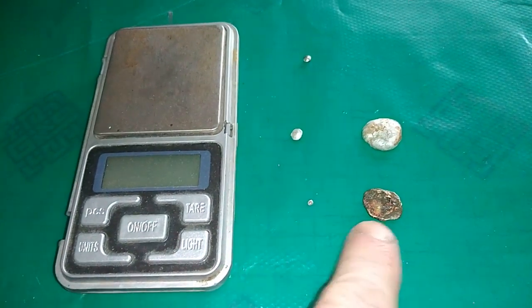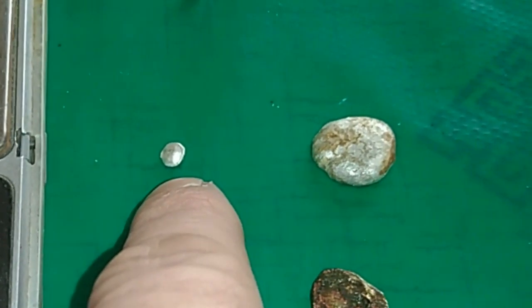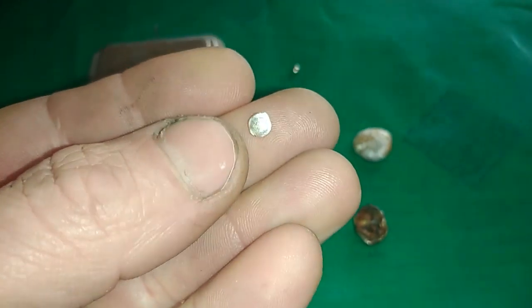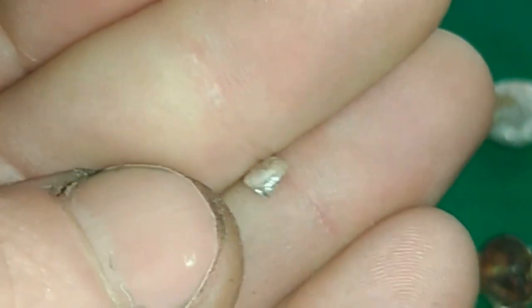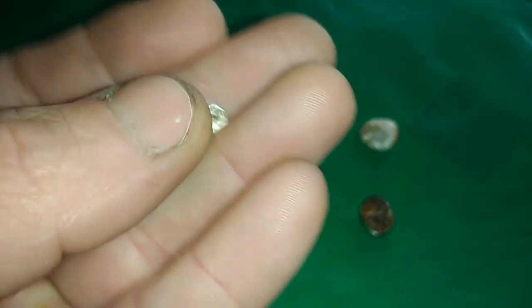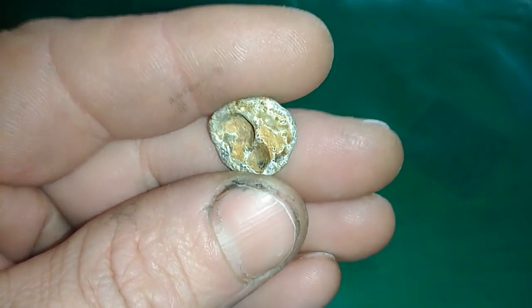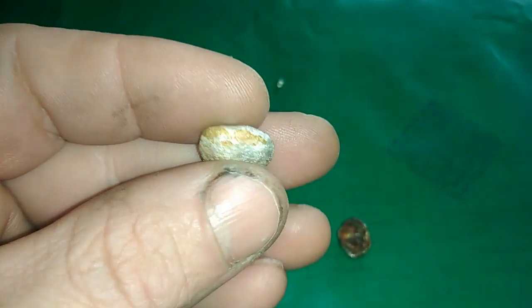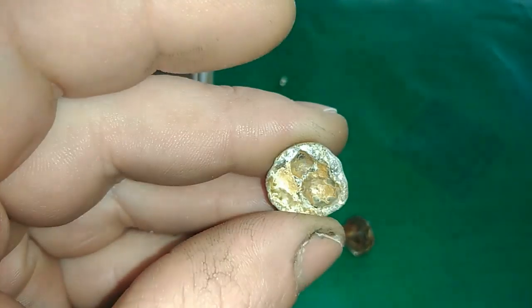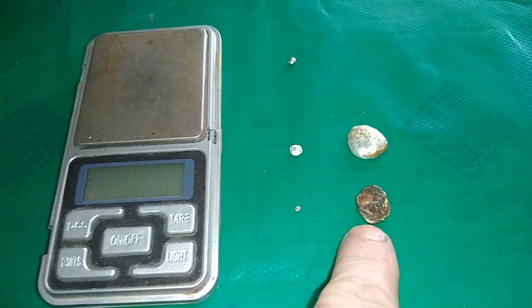This is from magnetic pins. This second line — this bead and this bigger bead — it's from non-magnetic MLCCs. This is our palladium from non-magnetic MLCCs. It's pure. You see, it's got some little holes in it and a very strange shape, but it's a very, very cool little bead from non-magnetic. And this bead of silver is also from non-magnetic MLCCs. I need to soak that too. But I will do that when I have some time. This yellow stuff is actually dirty borax. And you can see that from non-magnetic MLCCs I have more silver and more palladium than from magnetic MLCCs.